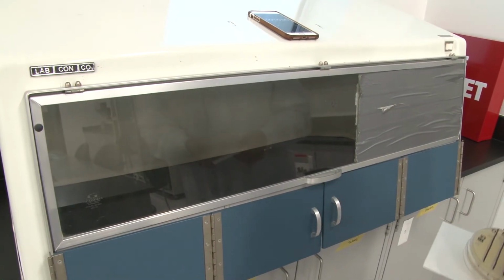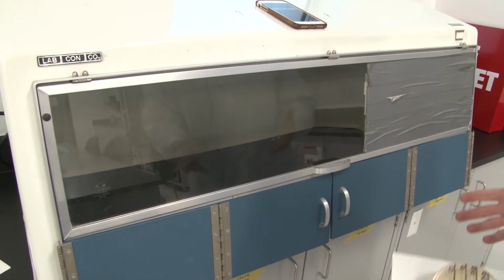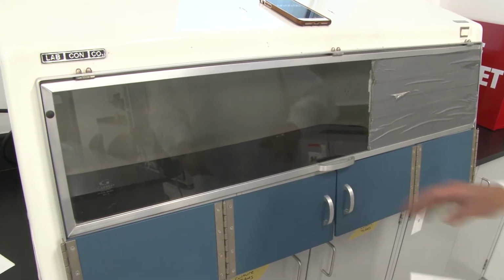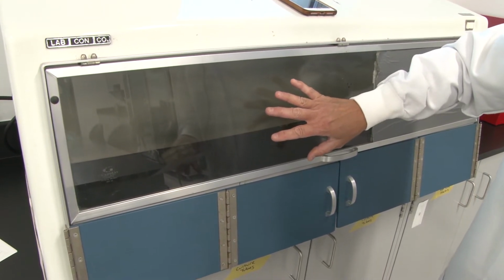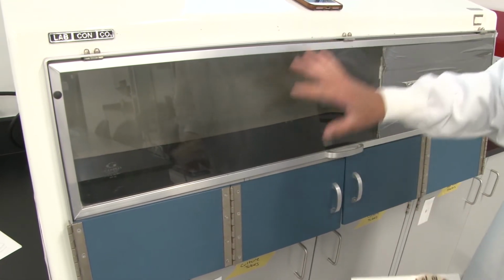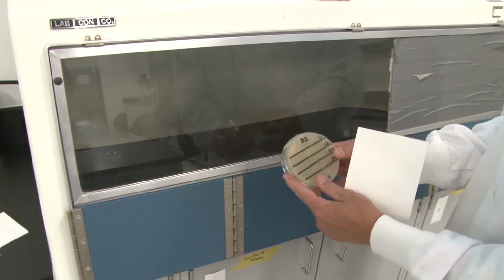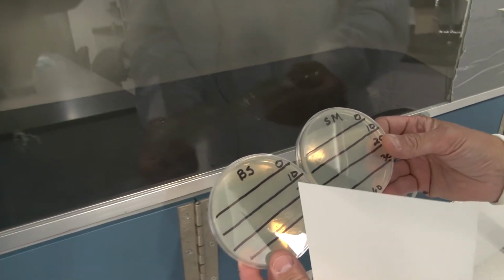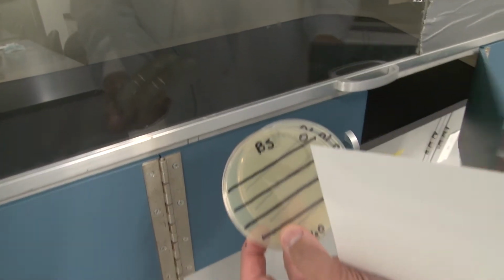Okay, here is our ultraviolet light box. You definitely don't want ultraviolet light in your eyes, so we have a glass here that's going to block that, and so we will not be turning on the UV bulb until everything is closed up. But right now, to get started, we need to take our plates, our Bacillus subtilis and Serratia marcescens lawns, and we need to get them under the UV bulb.